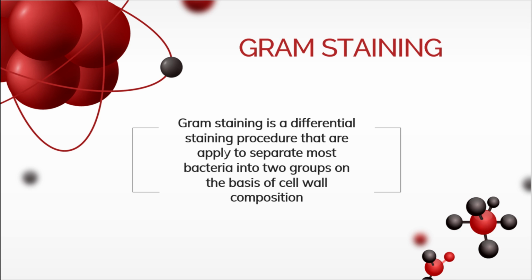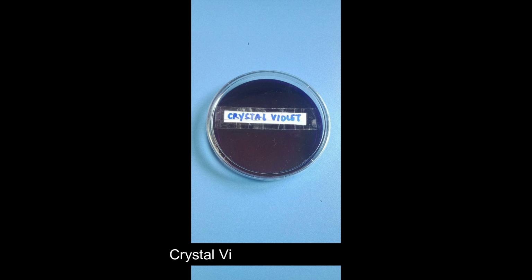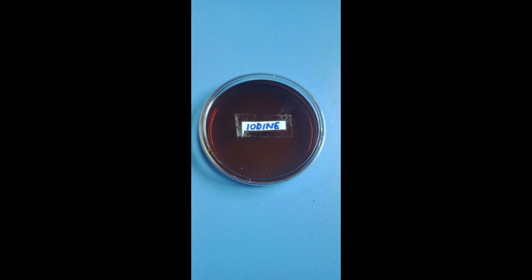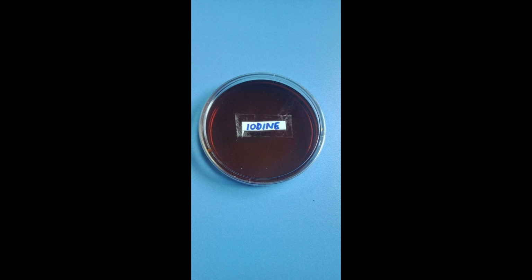During the gram staining procedure, four chemical reagents are applied sequentially to a heat-fixed smear. First is the application of the primary stain, which is crystal violet. Crystal violet will stain all cells purple. Second is the application of the mordant using iodine solution. Addition of iodine forms a crystal violet-iodine complex, which intensifies the color of the primary stain.